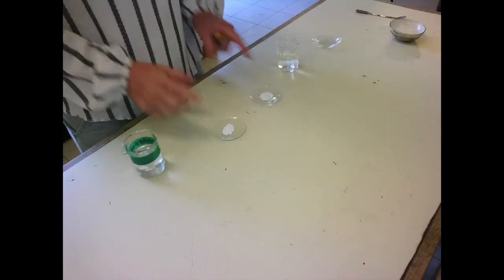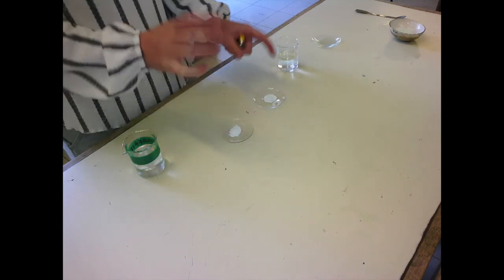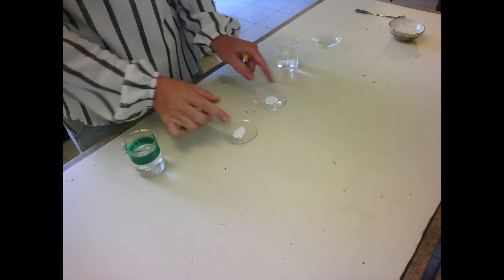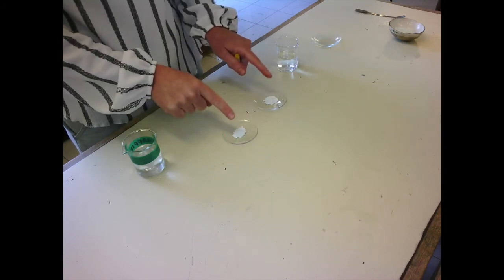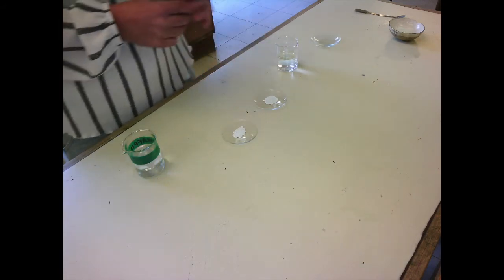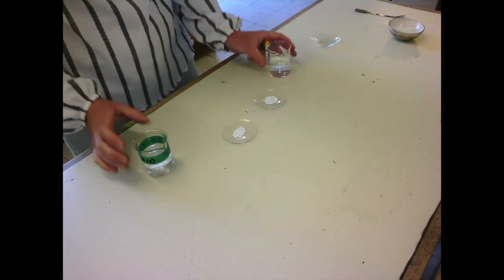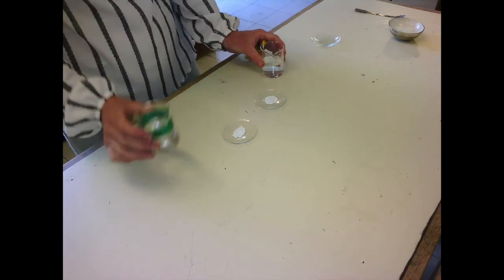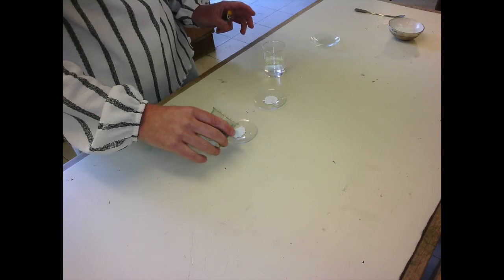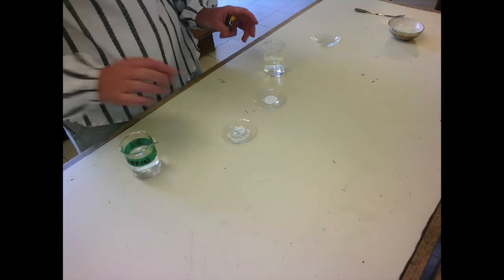Okay, so I've got my anhydrous copper sulfate, the blue copper sulfate that I heated up previously. I've removed all the water from it, and it's now a white powder. So it goes from blue crystals to a white powder once it's lost water. And just that it's a reversible reaction. If I add paraffin to the anhydrous copper sulfate, you can see no change, nothing happens.